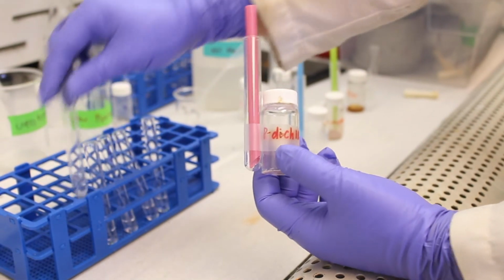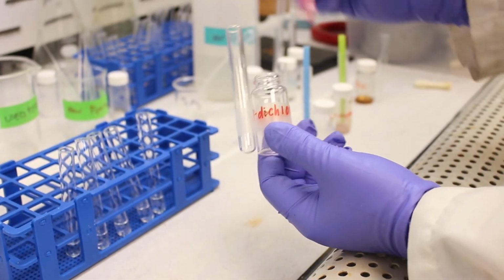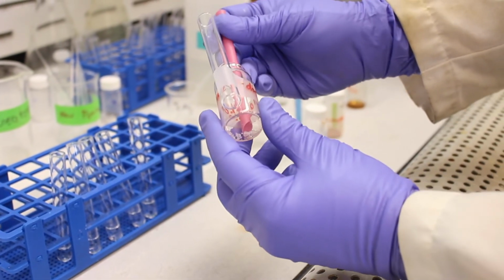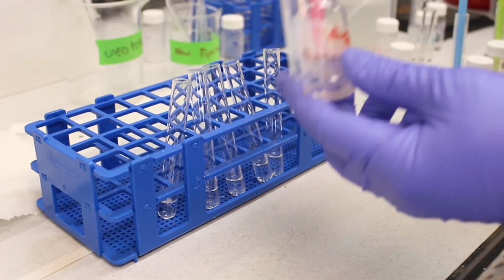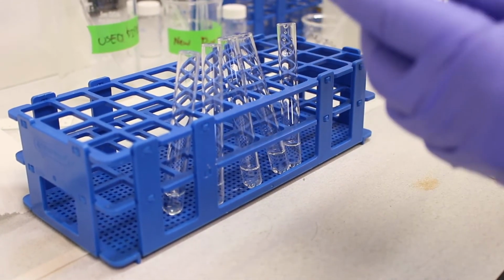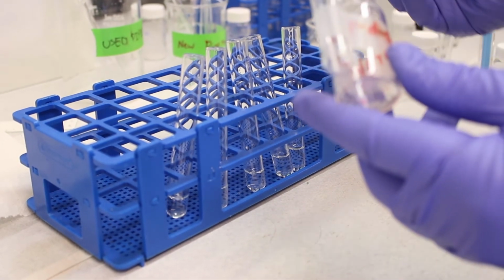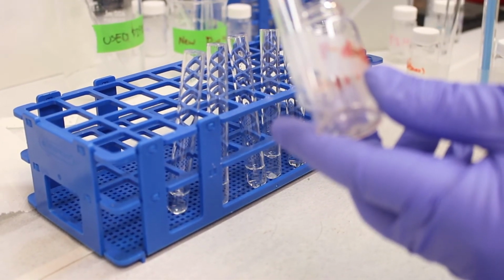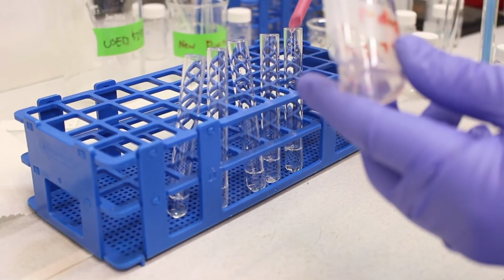And we have our remaining solvents to try. We would expect this compound, because it has an inert functional group, to be insoluble in all of these solvents. So I'll add a little bit to each tube here, and then we'll compare. The halide group cannot be ionized by any of these solvents, which is why it remains insoluble.